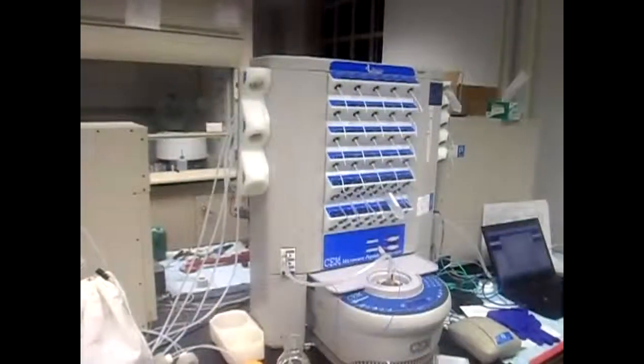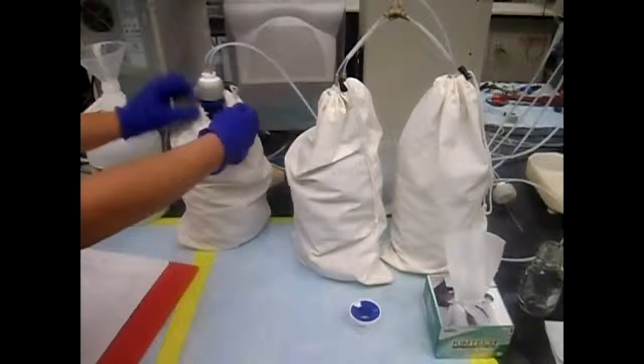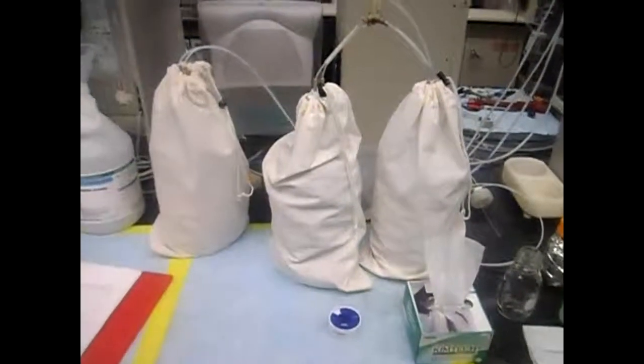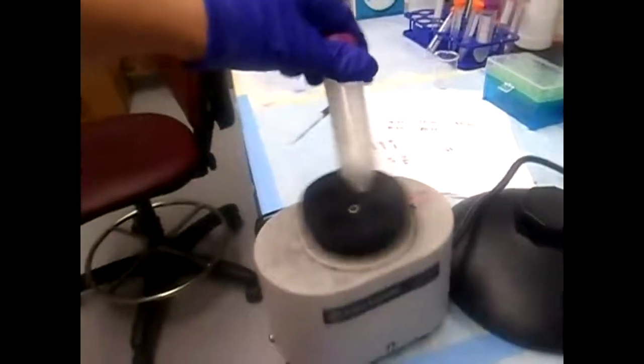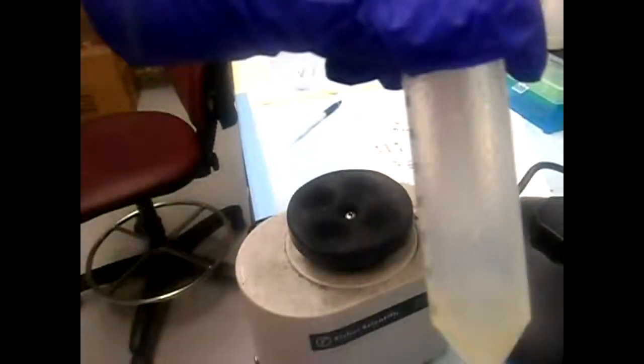The instrument also needs a constant supply of NMP and dichloromethane. These solvents are attached to the side of the instrument through pressurized caps that attach to the solvent bottle directly. The resin is also loaded onto a plastic tube and solvated with NMP. These beads are insoluble and swell up in the solvent.